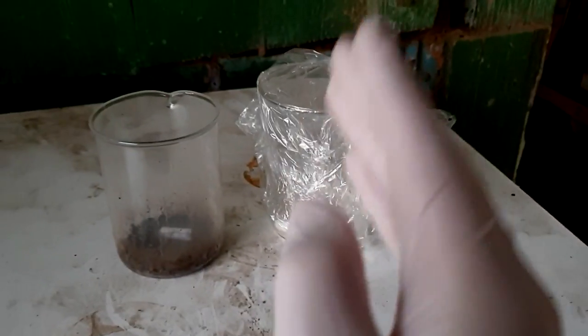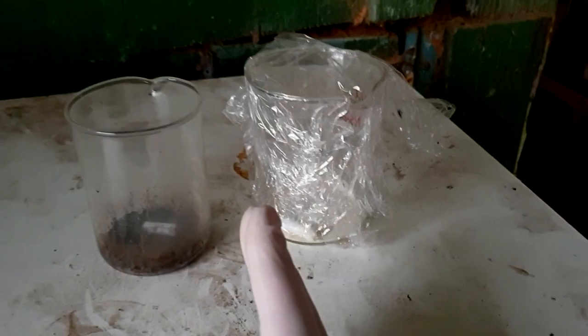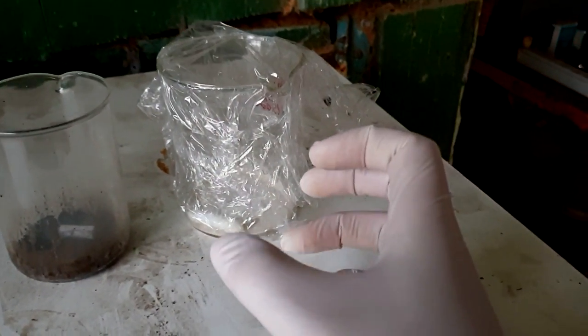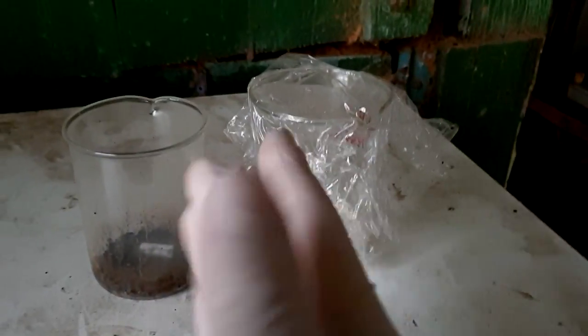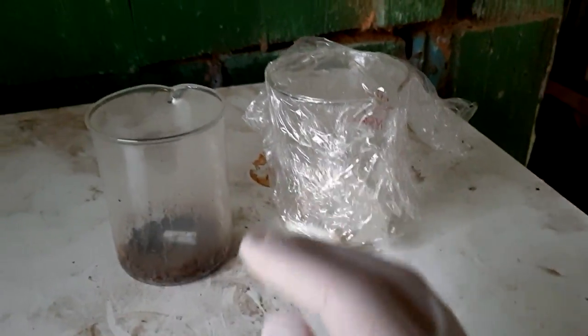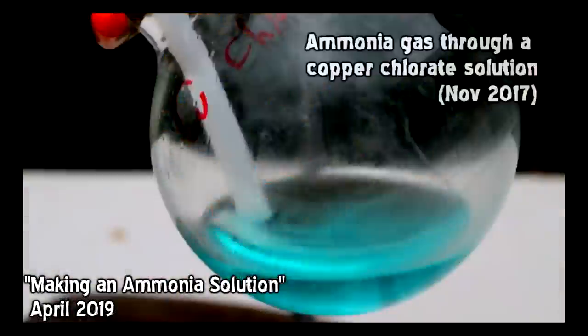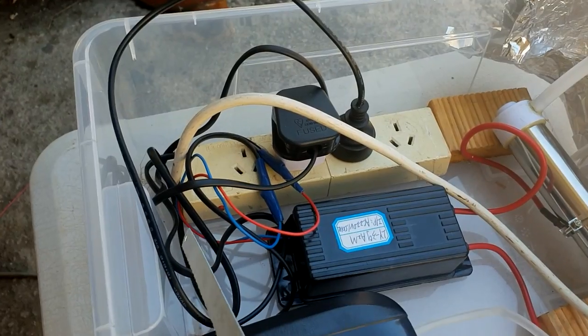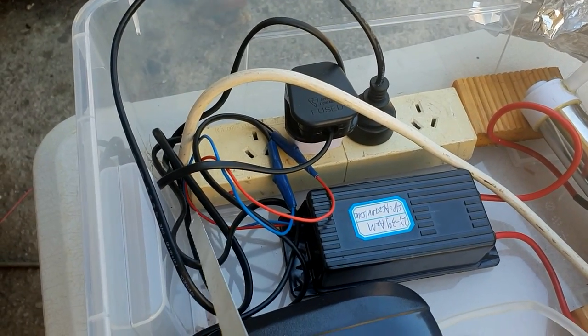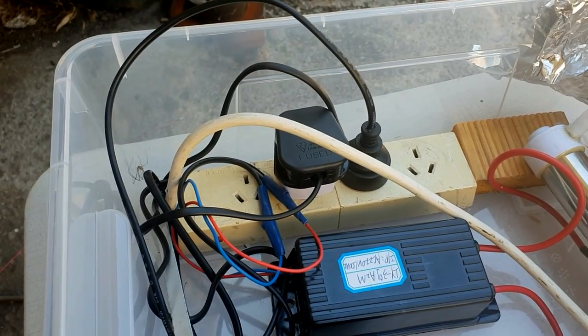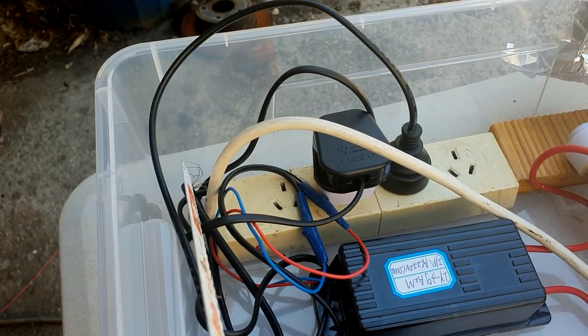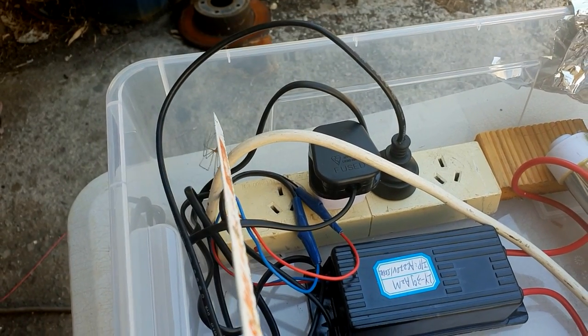I'm not ready to give up. So, what we have to do is we have to make a pure ammonia solution now. And, if we make one from scratch using our own ammonia generator and distilled water, then we can be absolutely certain that there's nothing in there.